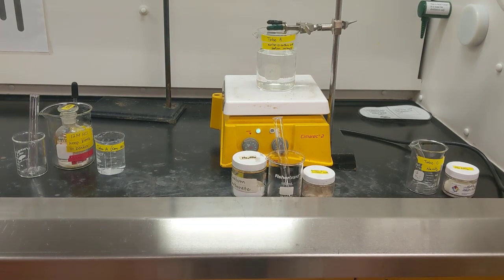Alright, for the azo dye lab we need to set up 3 different workstations for each of our test tubes. On the left, I'm going to have a test tube filled with 0.5 milliliter of concentrated hydrochloric acid, and then I'll prepare an ice bath, which is already there. For test tube B, I've got a warm water bath ready, and to that I'm going to add a test tube that contains aniline 2-sulfonic acid and sodium carbonate. And on the right hand side I've got test tube C, which I'm going to add sodium nitrite to. So let's go ahead and measure out each of those reagents.